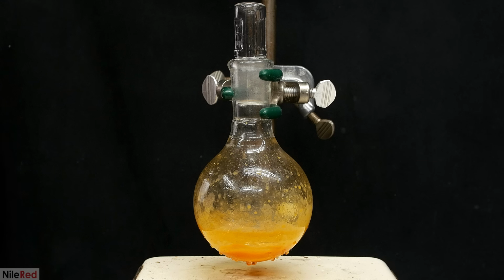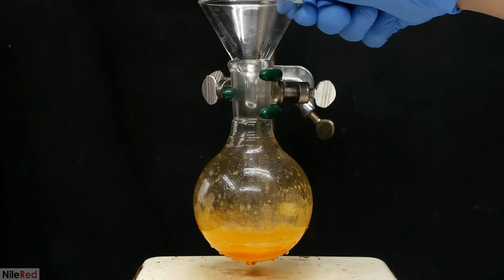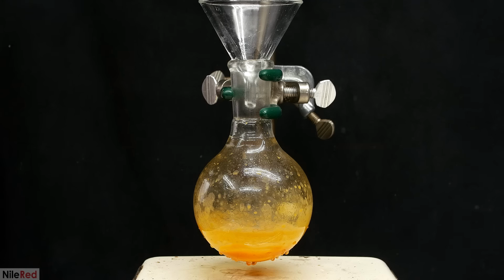In either case, though, I had a mixture of adipoyl chloride and a bunch of solid impurity. Unfortunately, most of the impurity comes from the dirty adipic acid that I started with. If I started with very pure adipic acid, I probably would have had relatively clean adipoyl chloride at this point. Anyway, it is what it is, and I now need to separate my adipoyl chloride from the other solid junk.